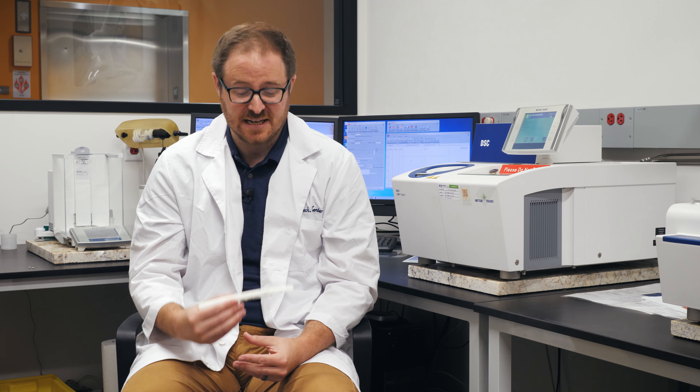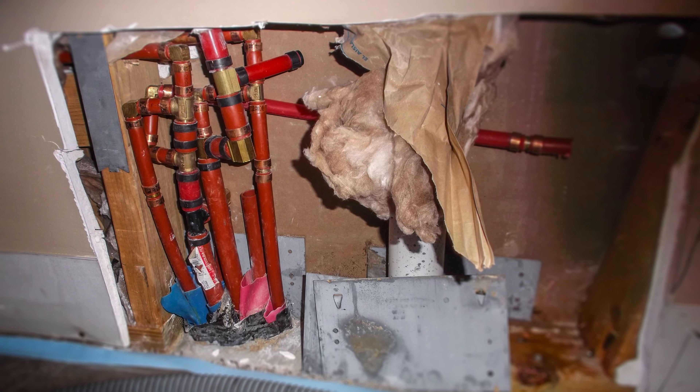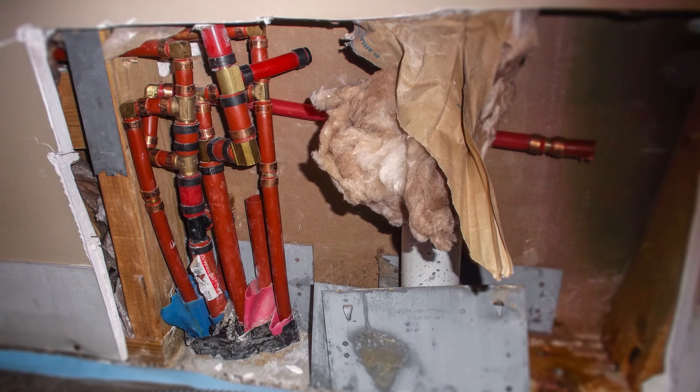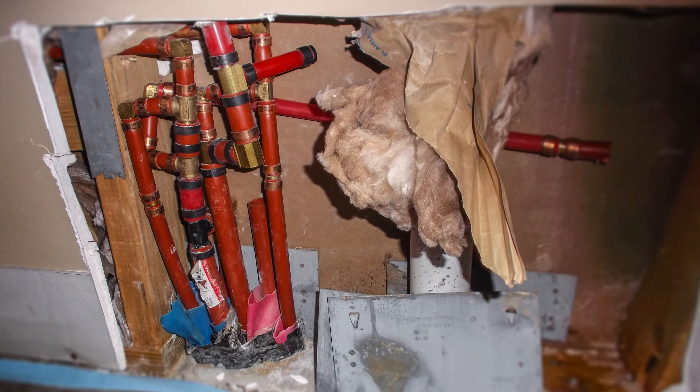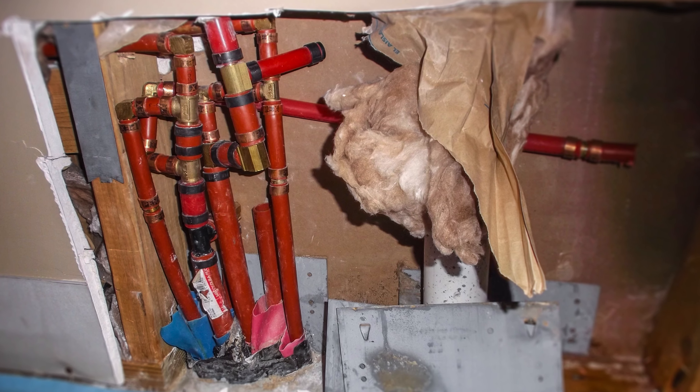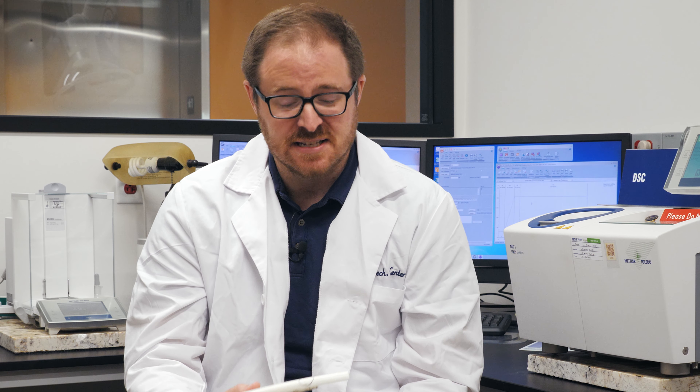Clients often come to us regarding plastic pipes such as this one. For instance, a plastic pipe that's been installed in a hot water application that it's not rated or formulated to deal with. What happens in those cases is that the pipe will oxidize.